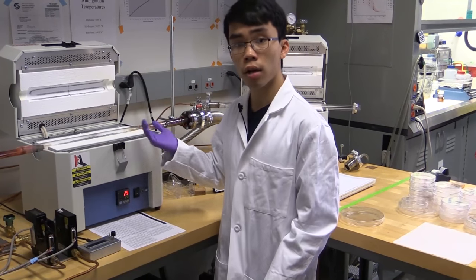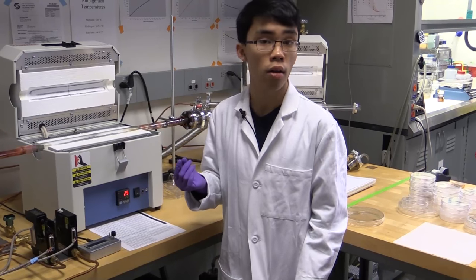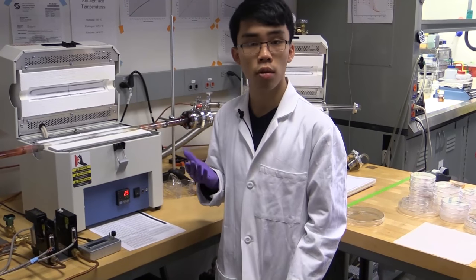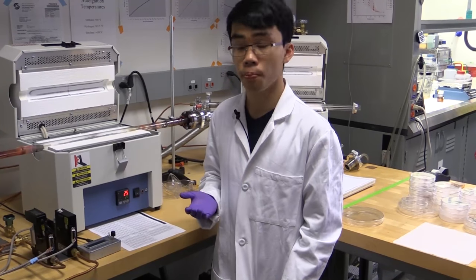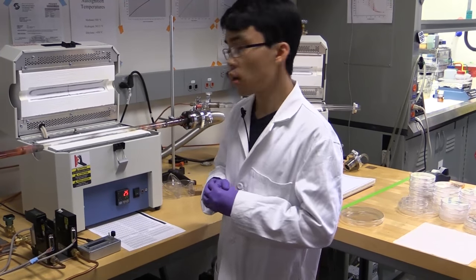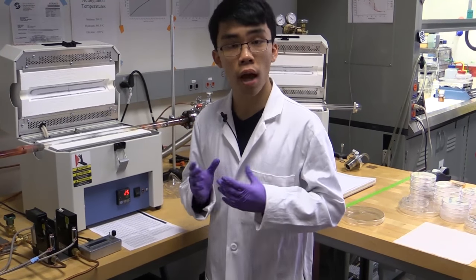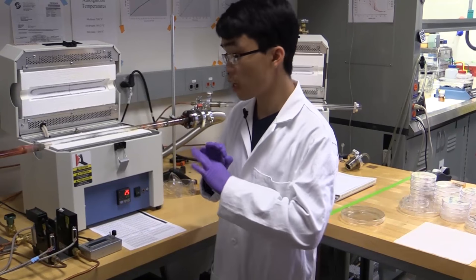Since you are relying on a temperature gradient, the actual zone or area on your substrate where you will get crystal growth is limited. So today, we are going to actually use a new heating scheme, where we have two quartz tubes nested with each other.